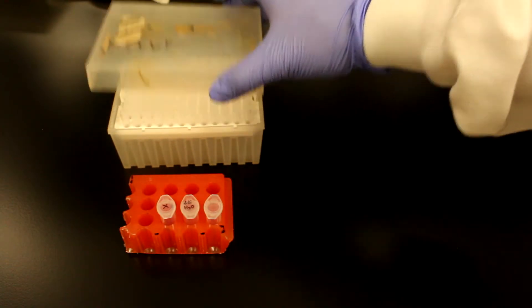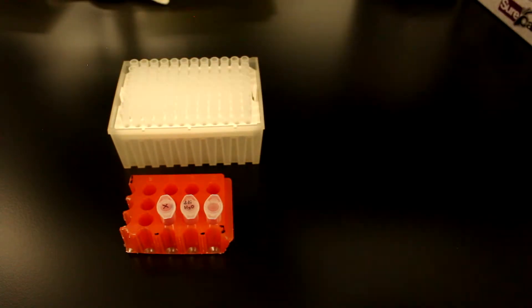The tip box is opened and kept open for only as long as the experiment requires tips. Take care not to contaminate the tip box with spills, skin contact, or breathing or talking over the exposed tips.